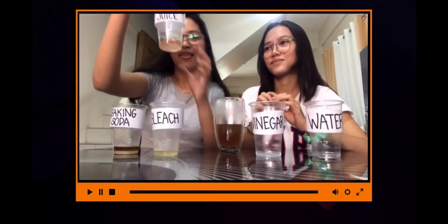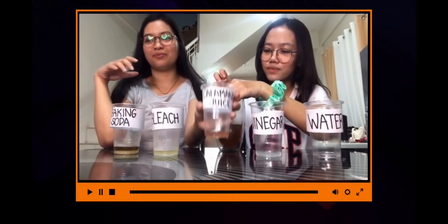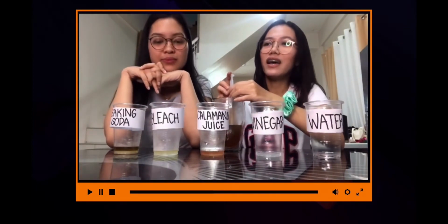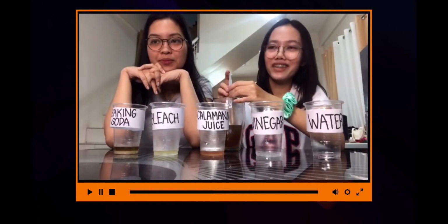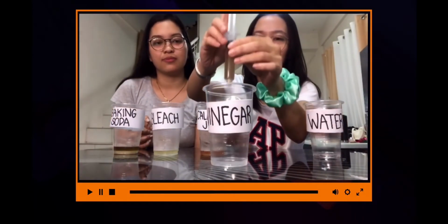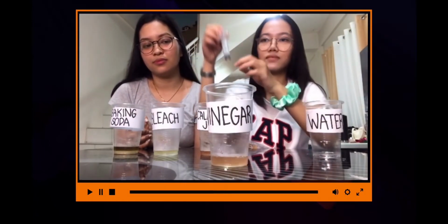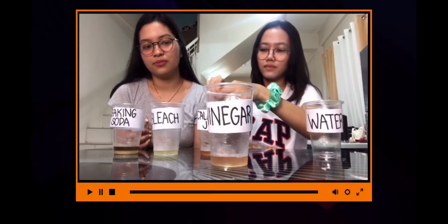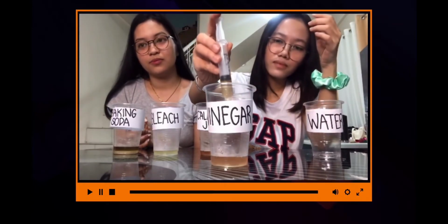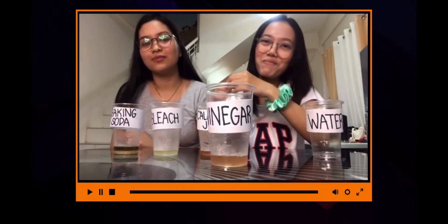Mmm! In this sample, the color turned into pinkish red. So for the fourth sample, which is the vinegar, let's all see what color it would turn to. So obviously, it turned pink.